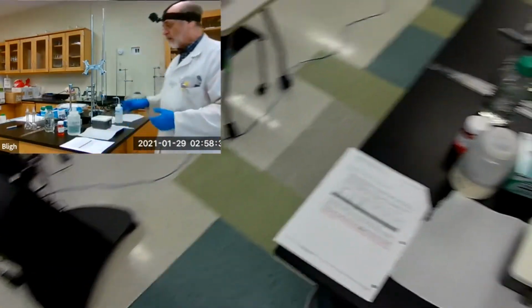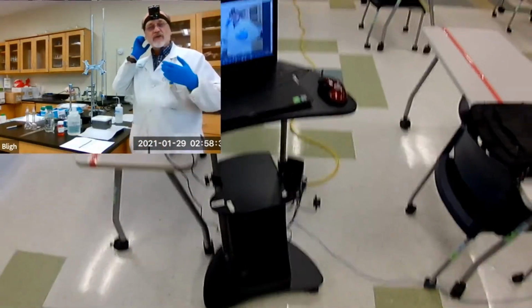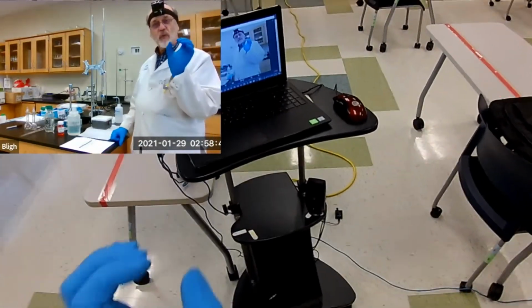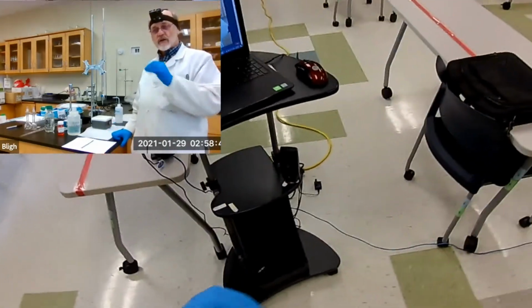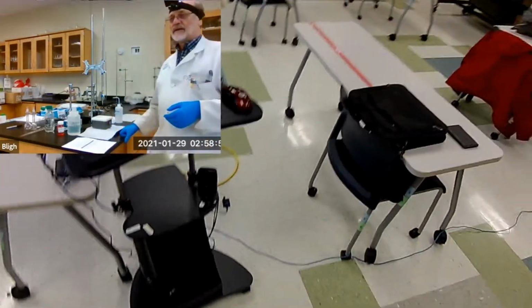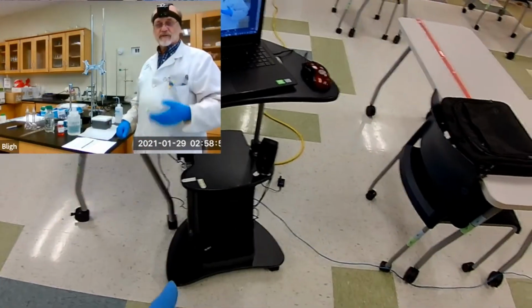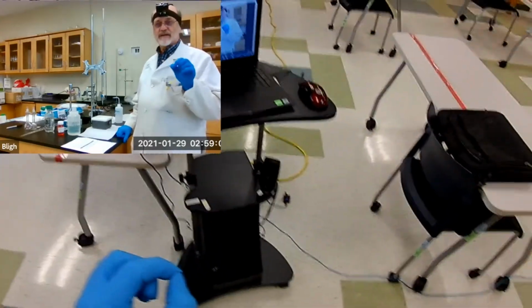Okay, I will say that while we're titrating, how do you know where the endpoint is? Well, I mentioned earlier, the endpoint is where the silver chloride forms and remains persistent. The method originally said, look for a persistent opalescence. So silver chloride would sort of reflect light. But it's difficult to see that in a brightly lit laboratory environment. So what we use here to detect the presence of a precipitate is the Tyndall effect.